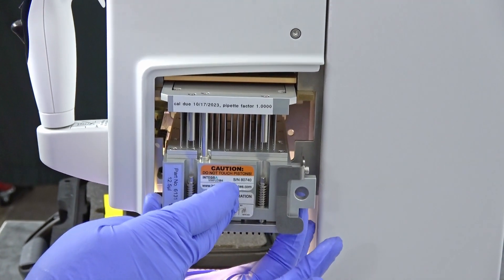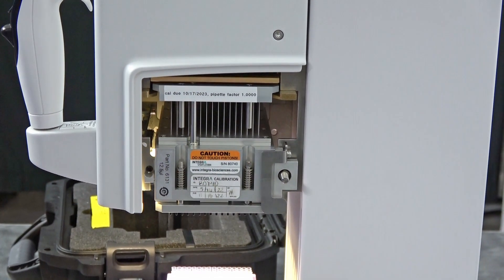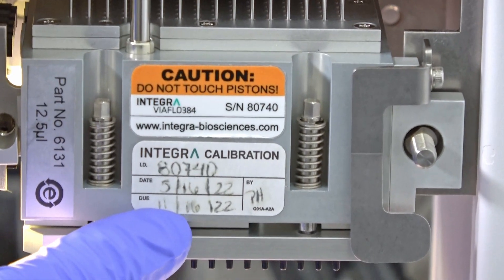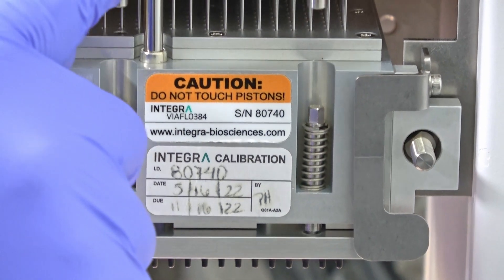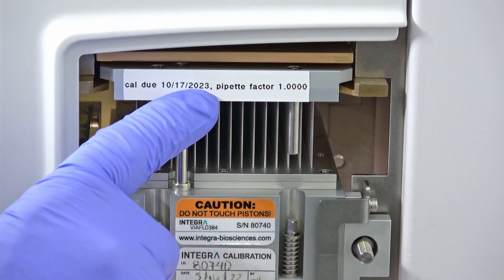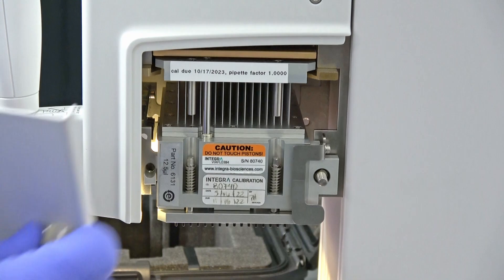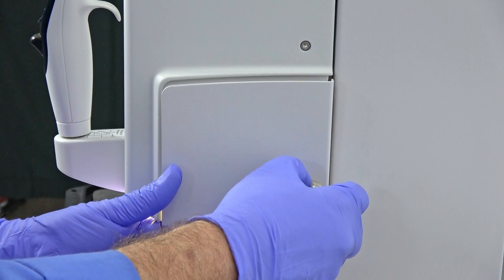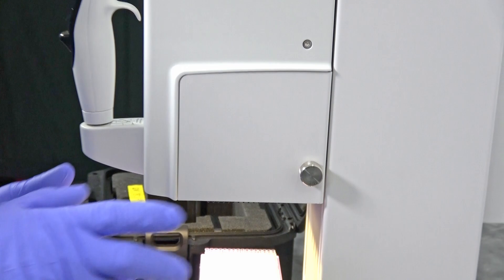And while we're here, I'm just going to point out too that the calibration is actually still good on this unit. The next calibration due date is 10/17/23, so later in the year. So it's not been too long ago since it was calibrated. So we're gonna go ahead and just slide this back on, tighten the knob back all the way, and once you're done, close cover.